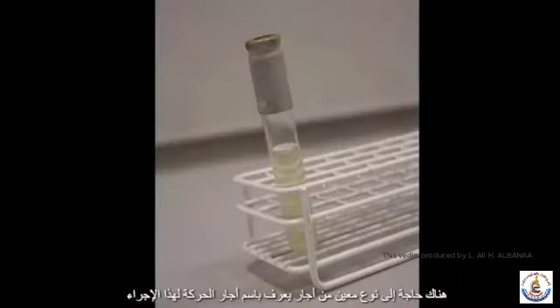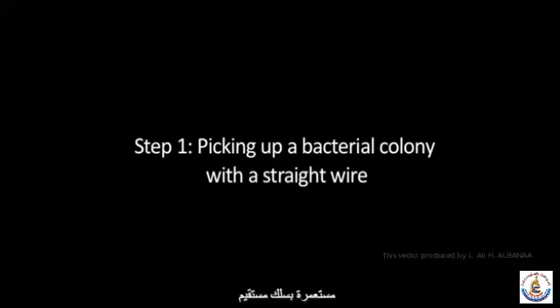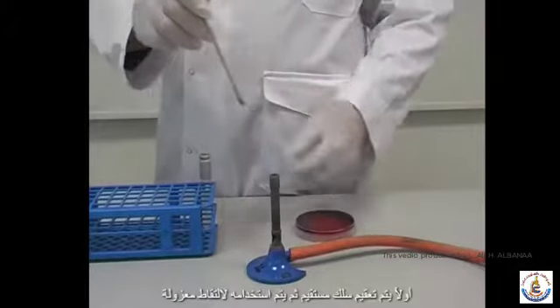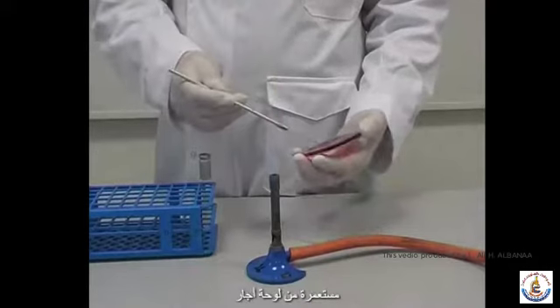A specific kind of agar, known as motility agar, is needed for this procedure. It is semi-solid and contains tetrazolium salts. Step 1. Picking up a bacterial colony with a straight wire. Firstly, a straight wire is sterilized. Then it is used to pick up an isolated colony from an agar plate.